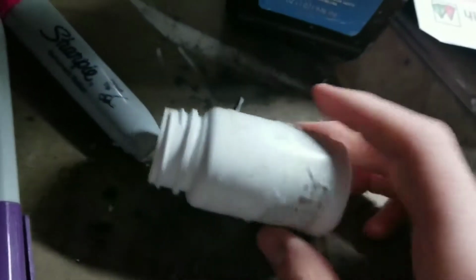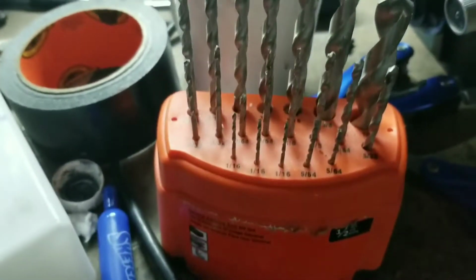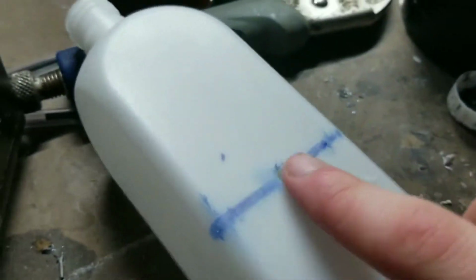Actually, before I remove the label, I'm going to cut it off on each side, about at the point of the label. Now what you've got to do is drill it. I've drilled a 1/16th guide hole, and now I'm going to work my way up. 5/64ths, 3/32s, 7/64s, 1/8, 9/64s, 5/32s, 11/64s, 3/16ths, 7/32s, 1/4, 5/16ths, and I'm going to stop there because that's about the size of this baby's guide hole.